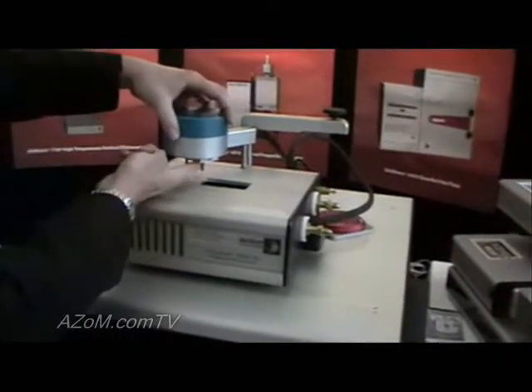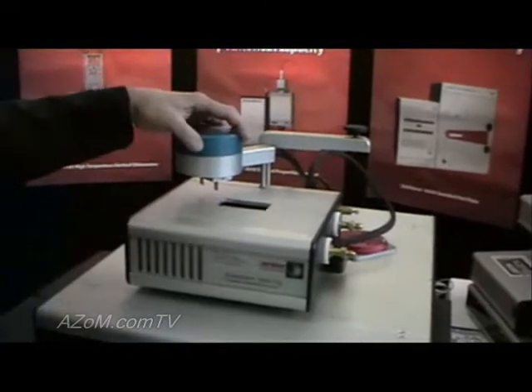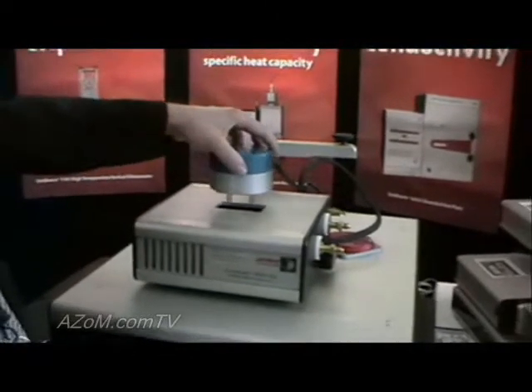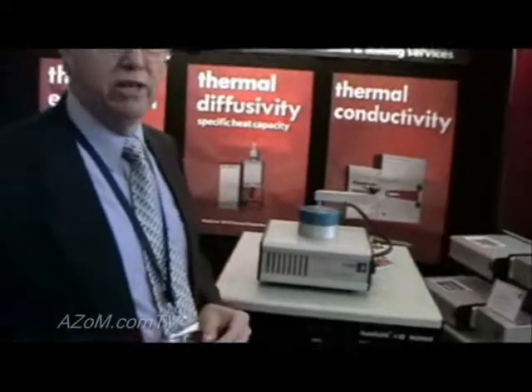We detect the heat response on the opposite side through direct contact with the top of the sample. It works across a wide range of materials and different atmospheres.